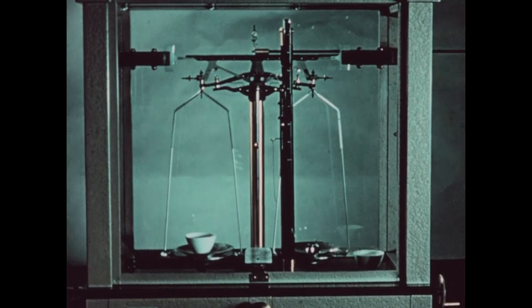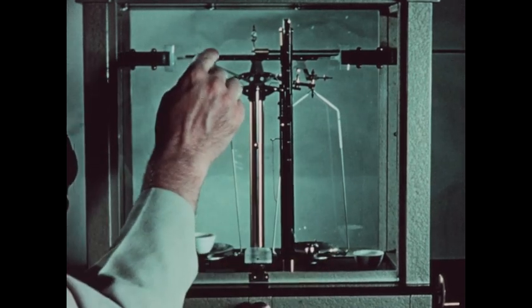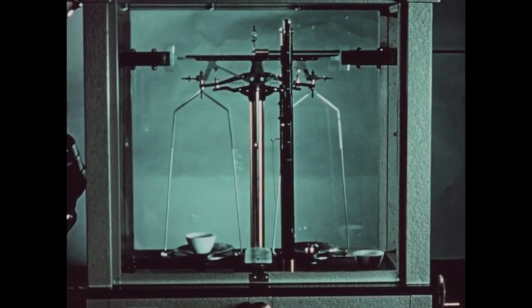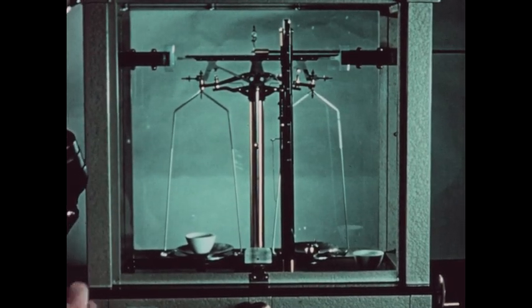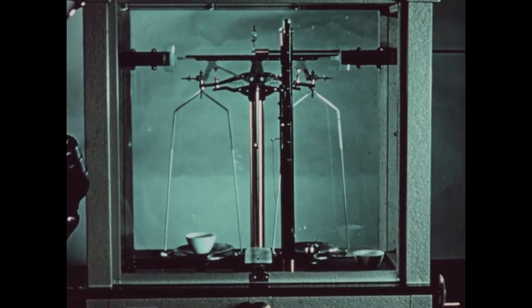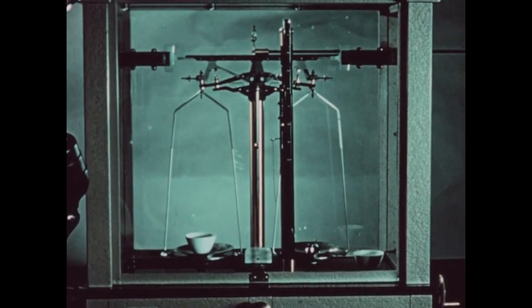The combined weight of the copper and the crucible has been determined and is found to be 11.466 grams. This should be entered on your data sheet in the blank for the weight of the crucible plus the sample. Similarly, a second piece of copper wire has been placed in crucible number two, and the combined weight of that crucible and its sample is 11.522 grams.